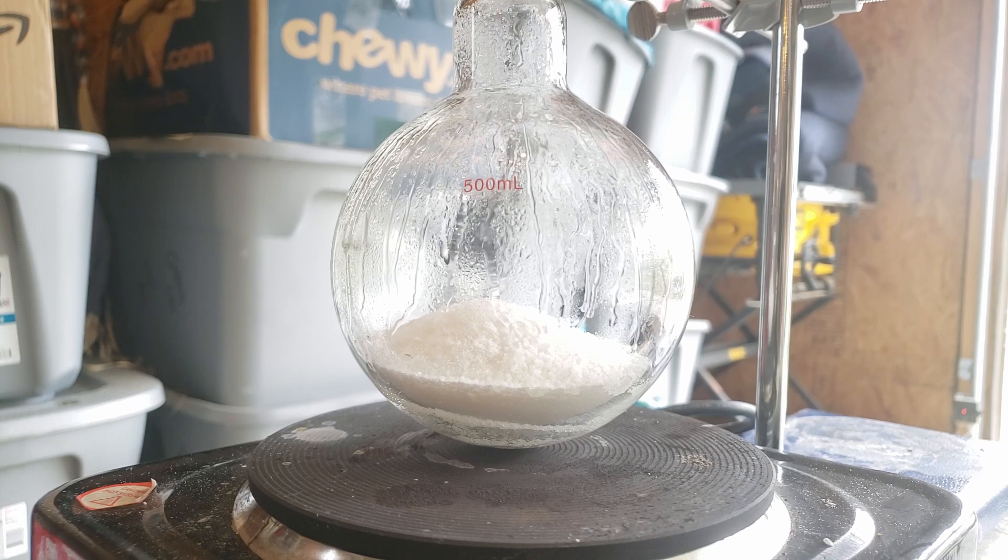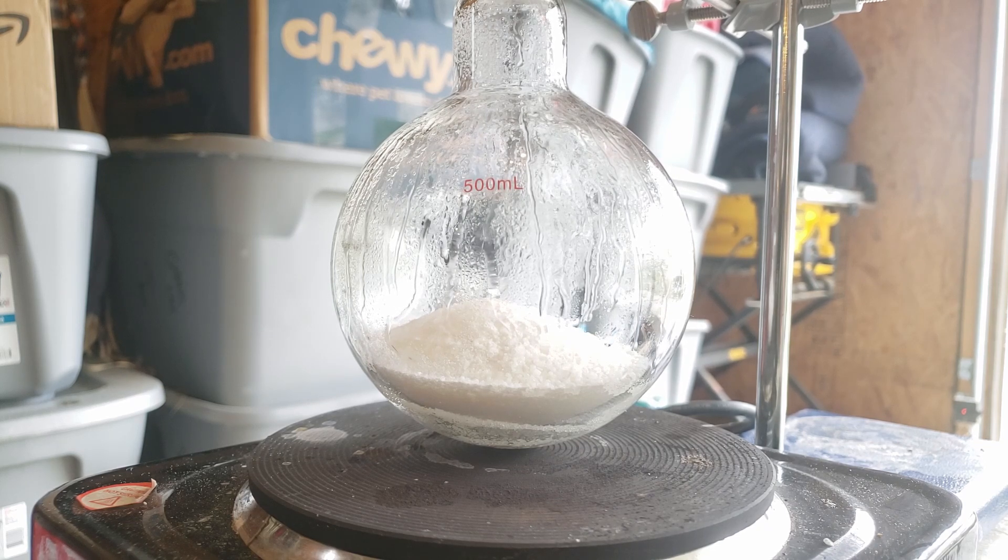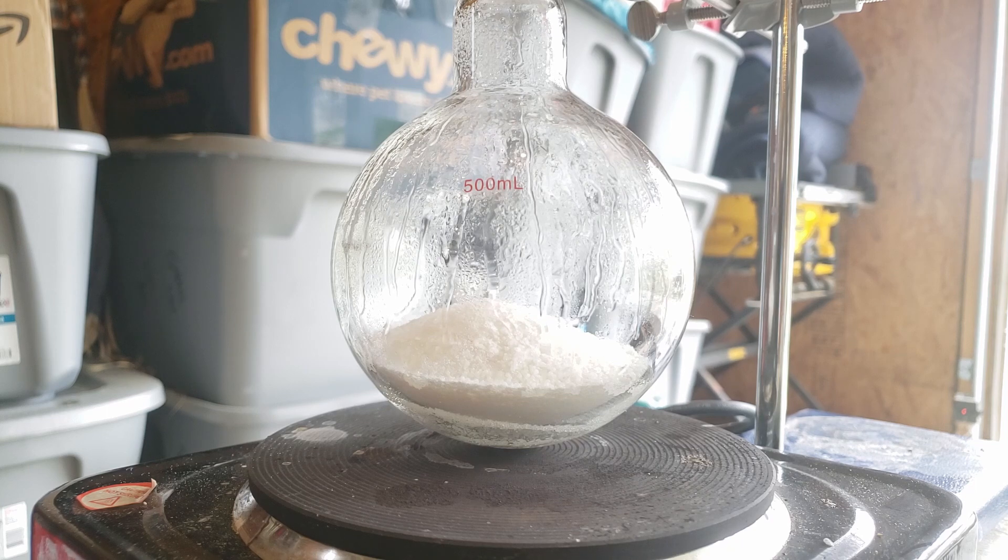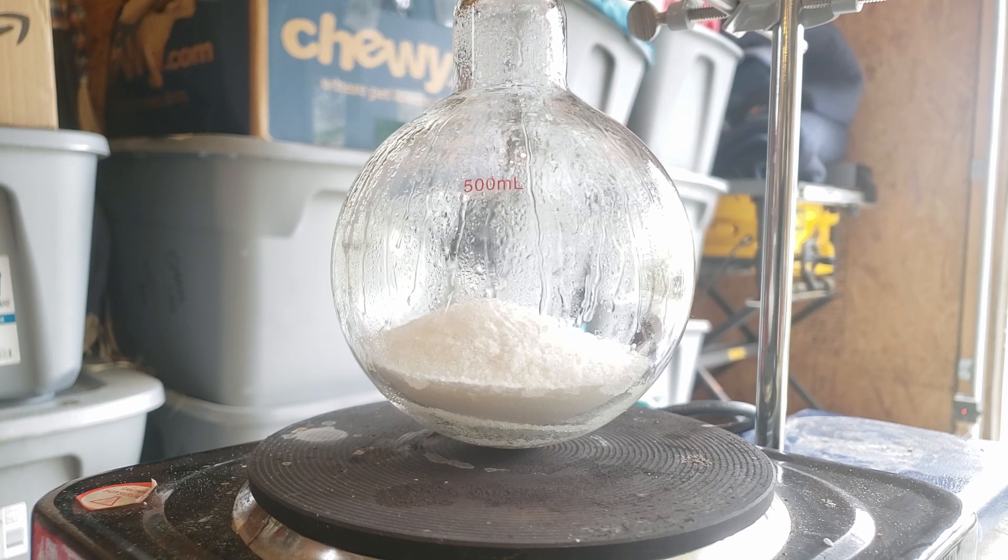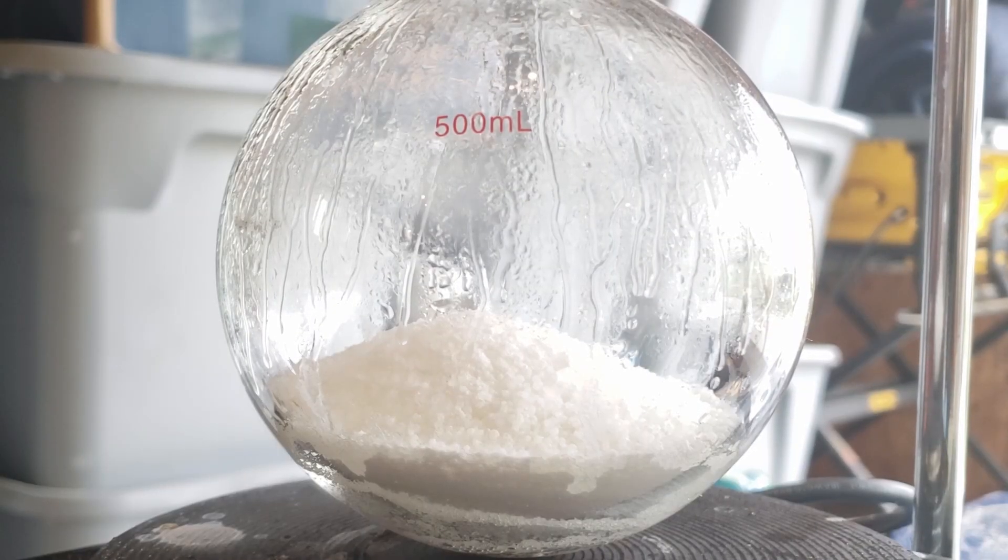Hello, and welcome back to another episode of Science with James. Today I'm going to be making highly concentrated acetic acid using sodium bisulfate and anhydrous sodium acetate.